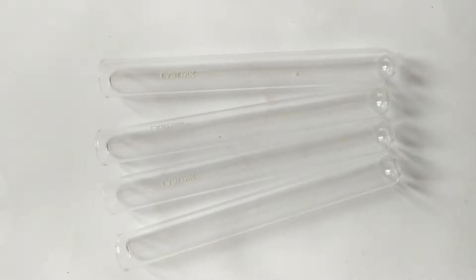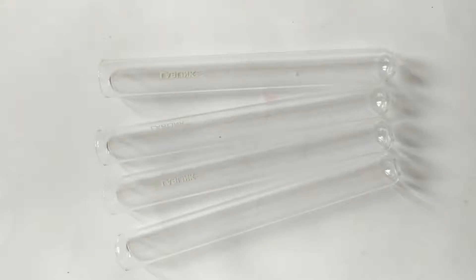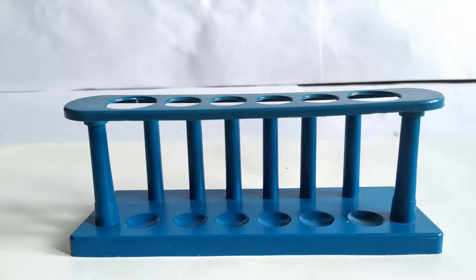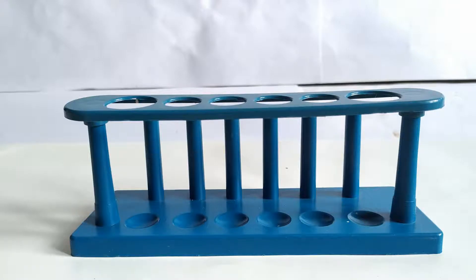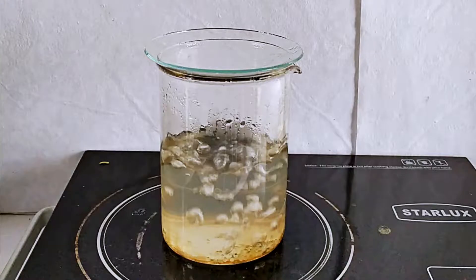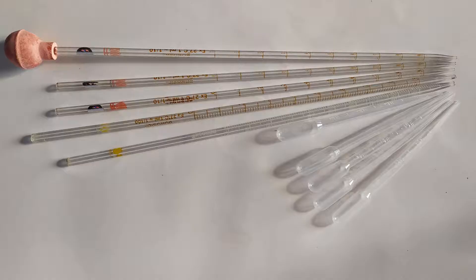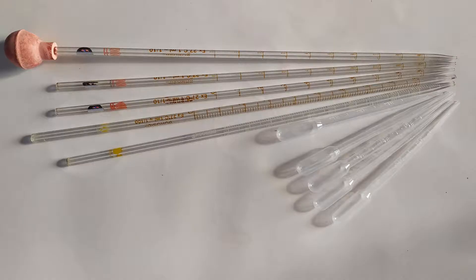We will also need 4 clean, dry, identical test tubes; a test tube holder; a test tube stand; a water bath; and 5 graduated droppers or pipettes of 1 or 2 ml capacities.